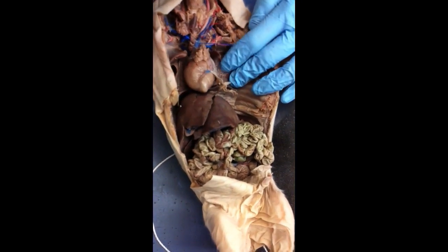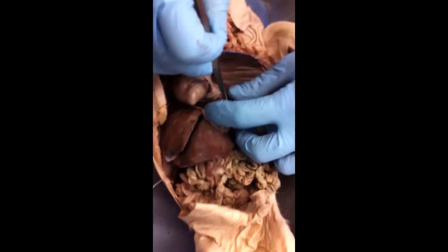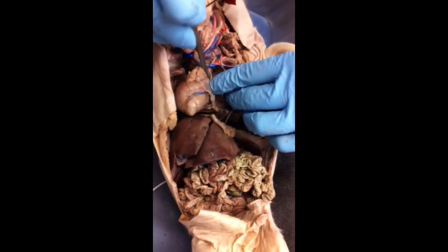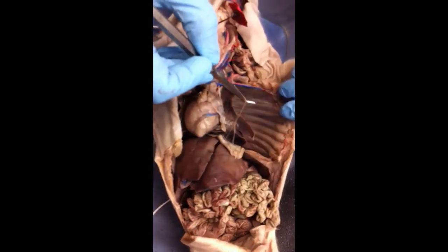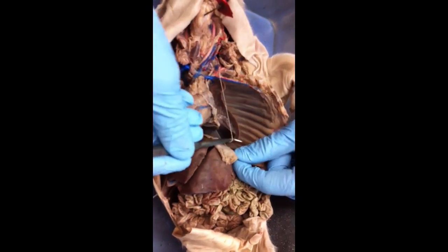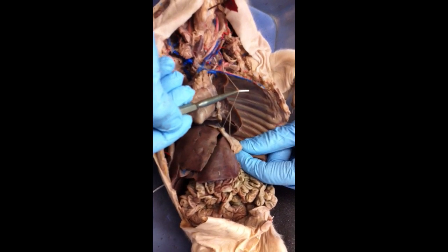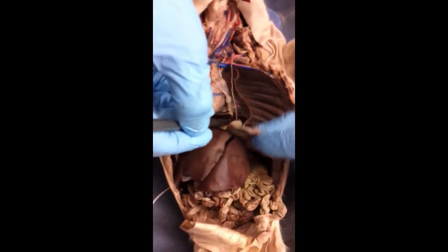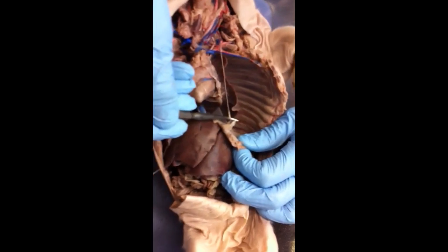You guys are going to have two types of nerves you need to identify. One is vagus and one is phrenic nerve. And you might see them on either the right or the left side because they're on both sides. So this one here that I'm showing you guys, they're going to look string-like, and so they'll probably have string around them for you guys to identify. This one you can see is going and innervating what structure that I'm holding up? Diaphragm. So this one is the phrenic nerve.